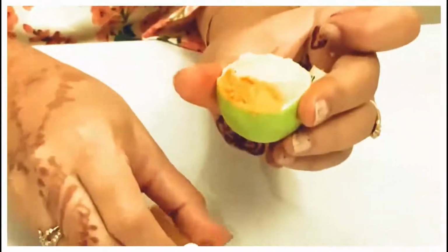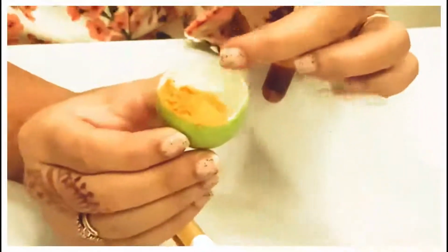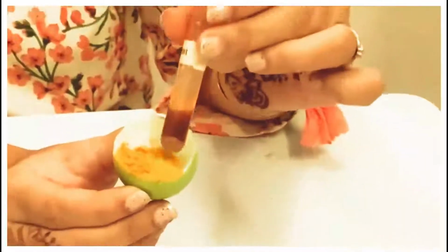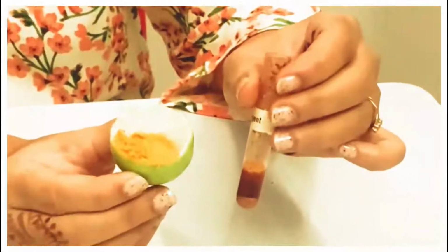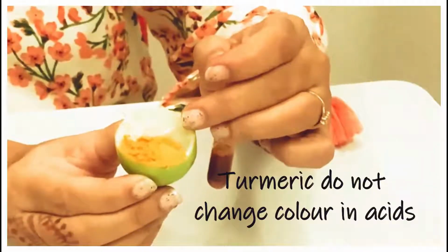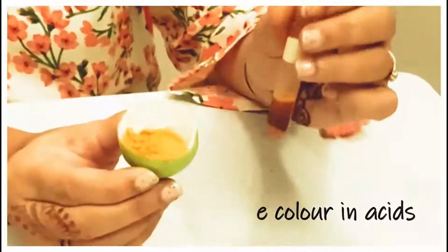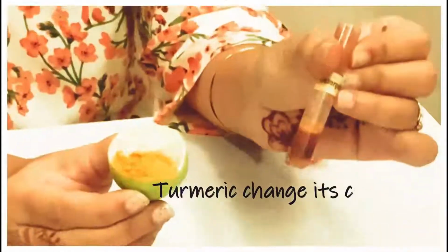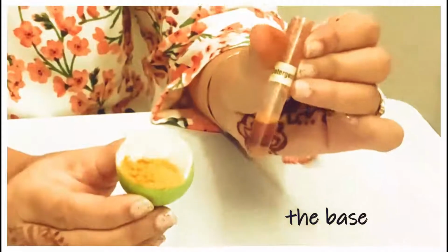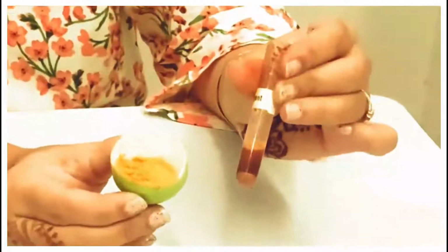Now just have a look. This is acid and this is base. Is there any color change in the acid? No. As you can see here, there is no color change of turmeric in the acid, and turmeric changes into blood red in the base. So this is the turmeric test for acids and bases.